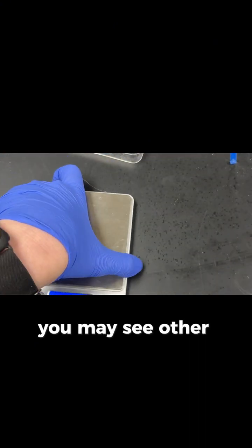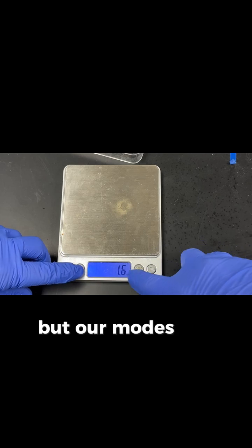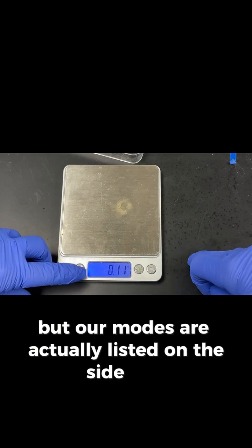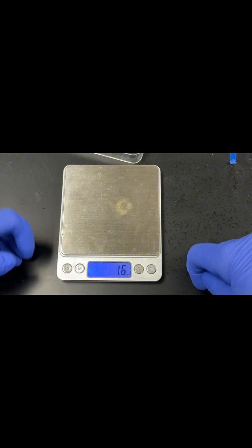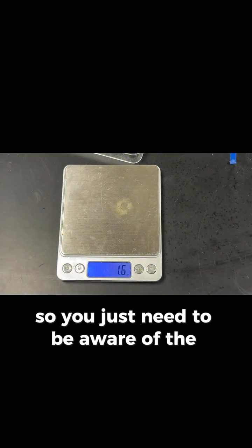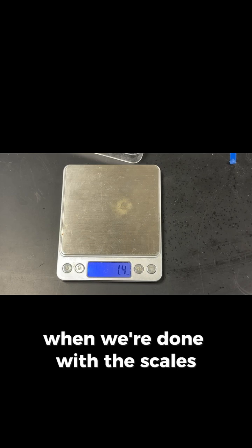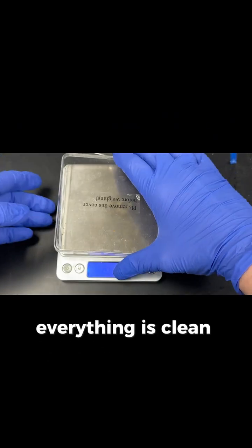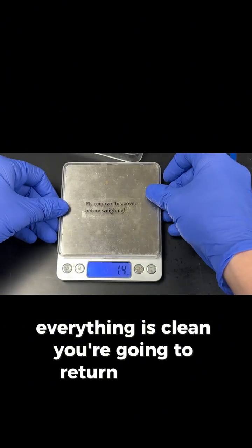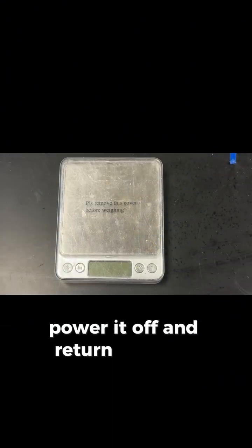You may see other scales. Here's a scale that looks similar, but our modes are actually listed on the side here. And so you just need to be aware of the differences between each scale. When we're done with the scales, make sure they are all wiped off. Everything is clean. You're going to return the lids, power it off, and return it to the teacher.